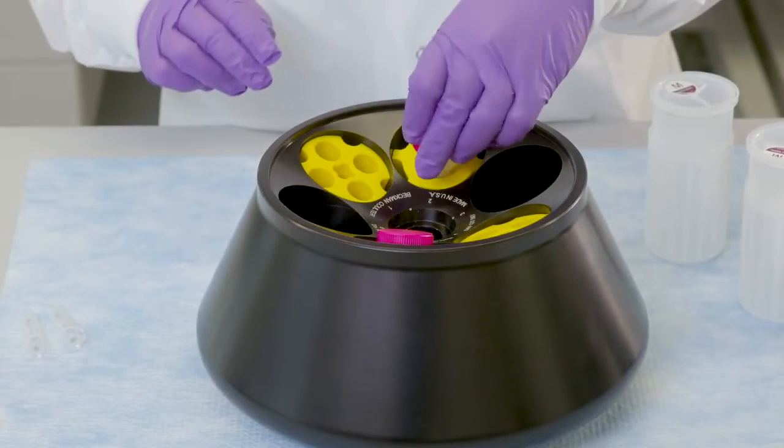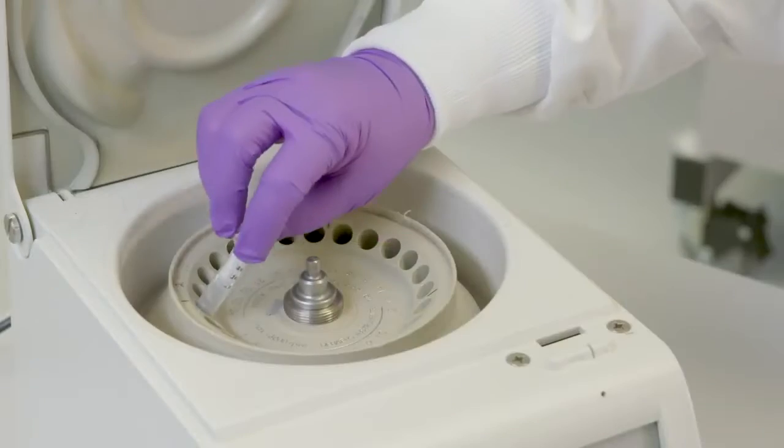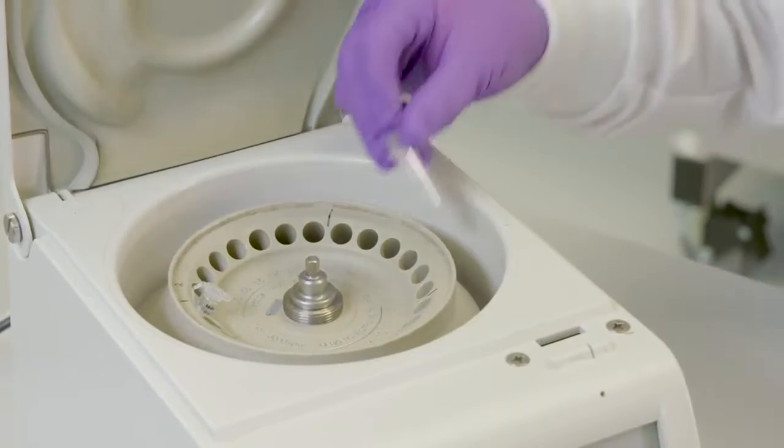First, a safety warning. When using centrifuges and rotors, please ensure they are properly balanced and follow your centrifuge manufacturers' safety instructions.